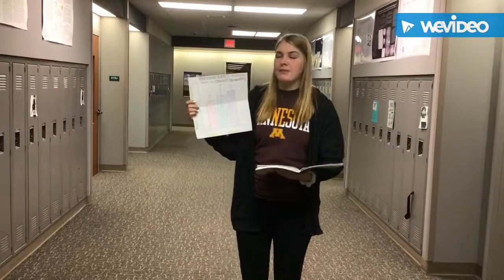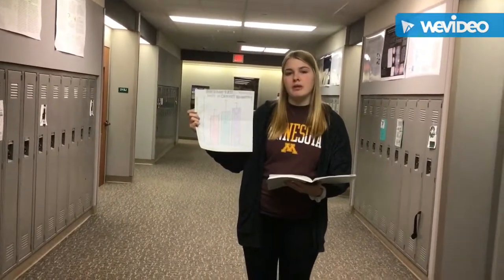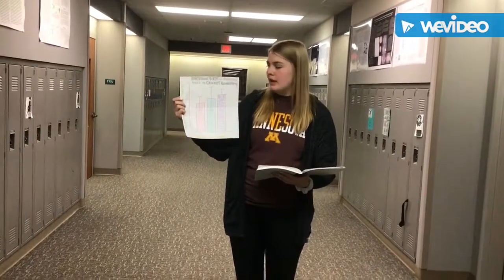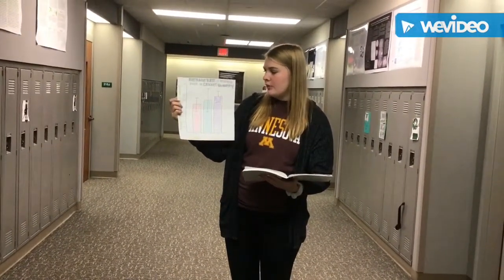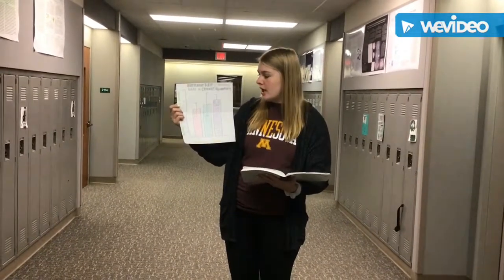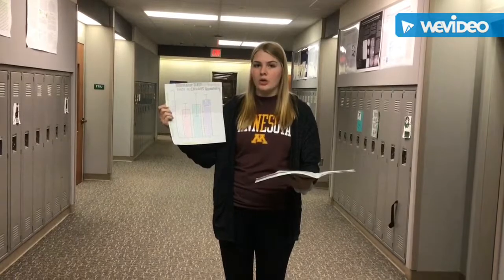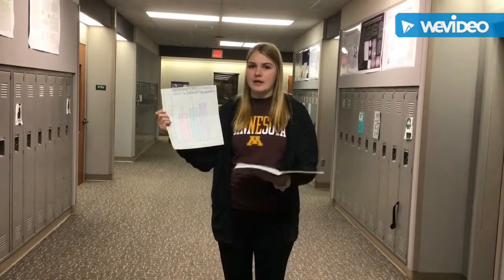Based on the graph that Megan has just described, she mentioned that the error bars do overlap. We found that using standard deviation and the 2 standard error bar equation. And since they overlap, it indicates that there's no correlation between the amount of crickets and the amount of CO2 gas. Sources of error in this lab include the crickets used.